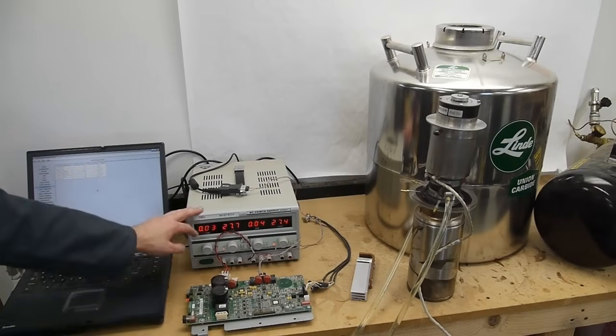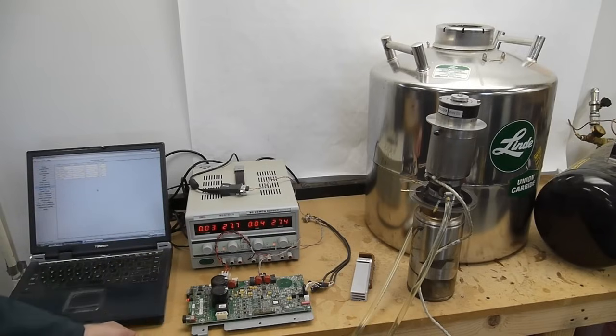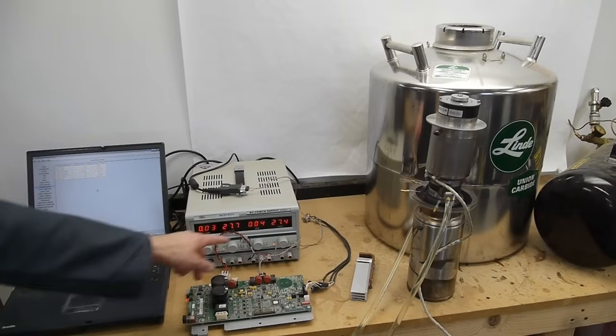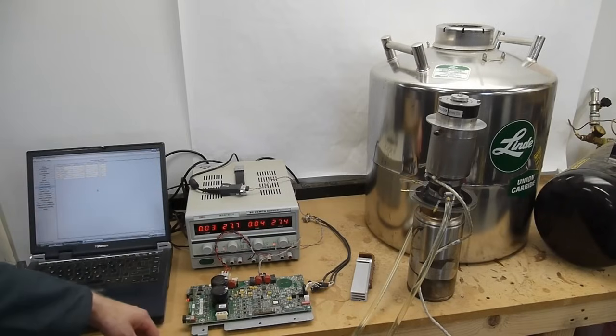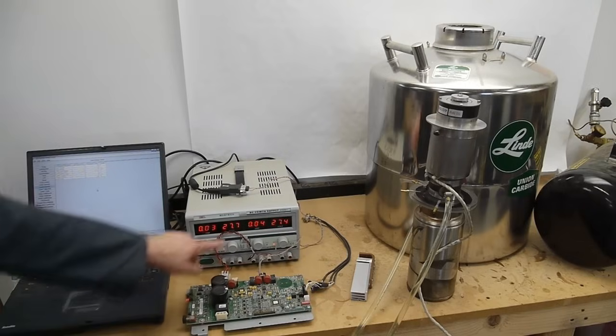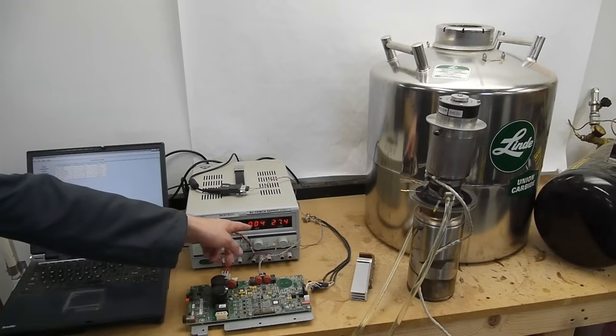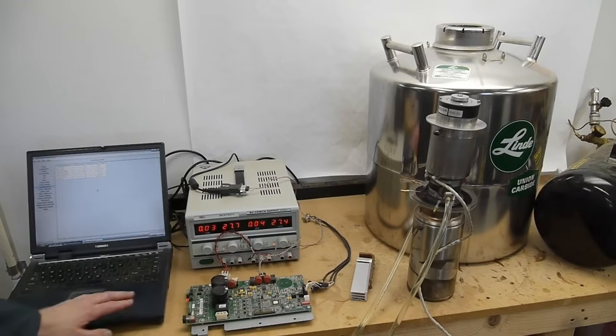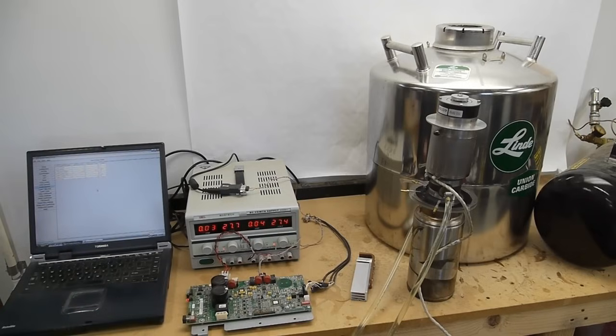I'm using a bench top power supply to power it. Since this is a telco piece of equipment it uses like a 27 or 28 volt standard so I'm giving it about 28 volts there. It's currently idling so it's only drawing 40 milliamps or something. When I turn it on via computer control we'll see it starts drawing quite a bit more.